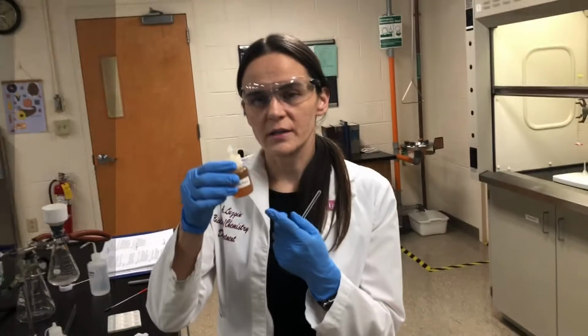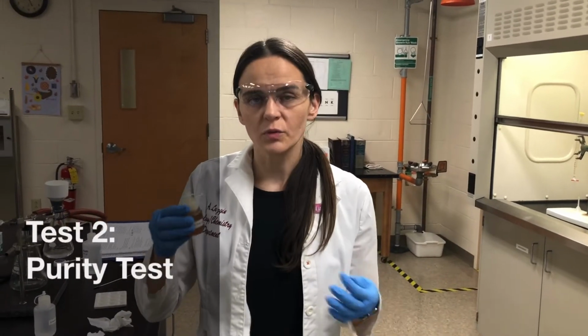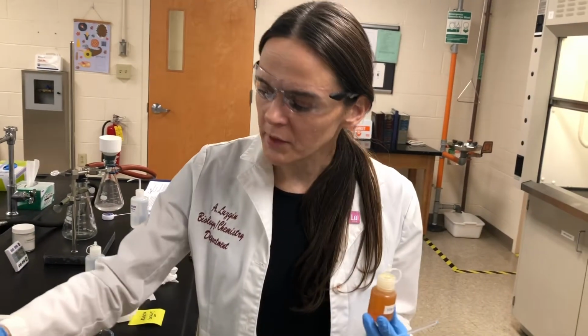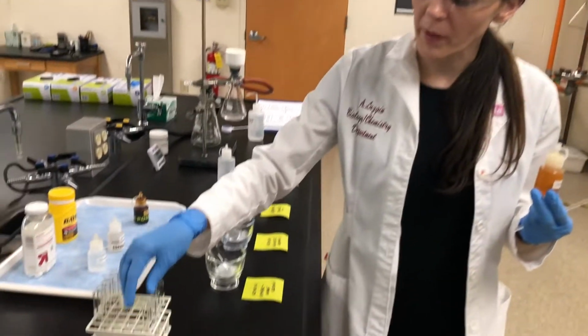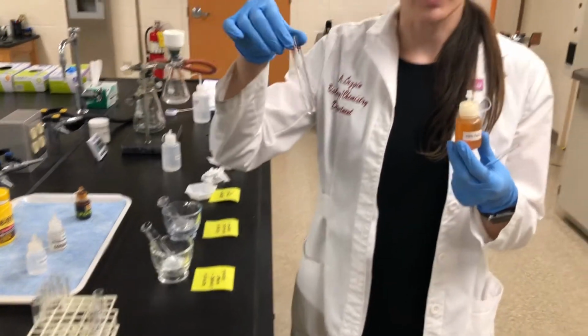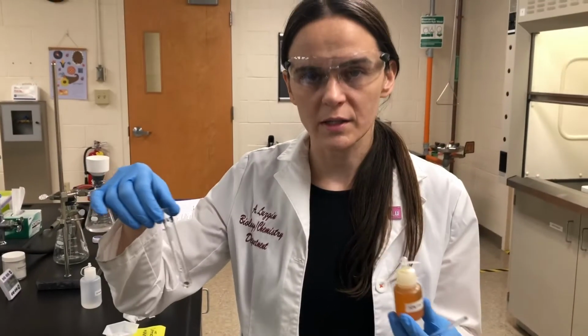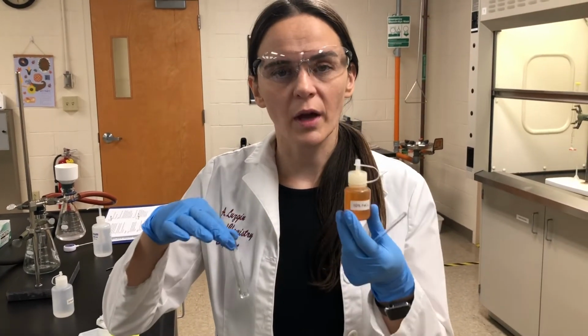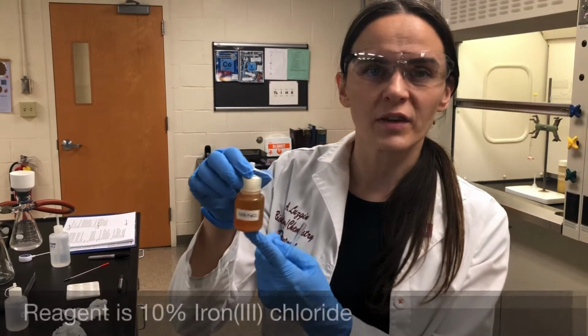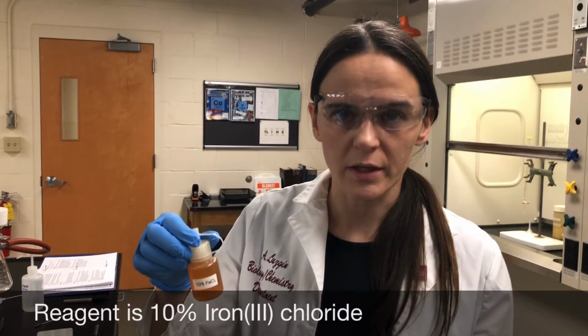What I'm going to do now is the iron 3 chloride test, which tests for the purity of aspirins. For this particular test, I'm again going to be testing the 3 aspirins, the Bayer, the generic, the crude aspirin, and also we have a control. The control does not have any aspirin, it only has water, and it's going to have a drop of the reagent. My reagent is 10% FeCl3, which is iron 3 chloride solution.